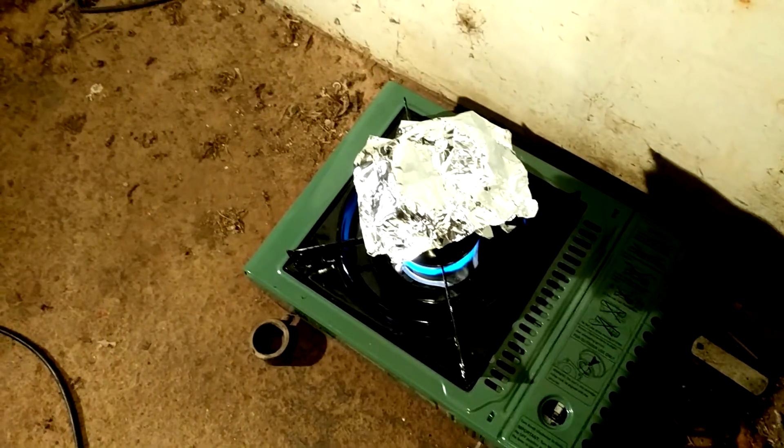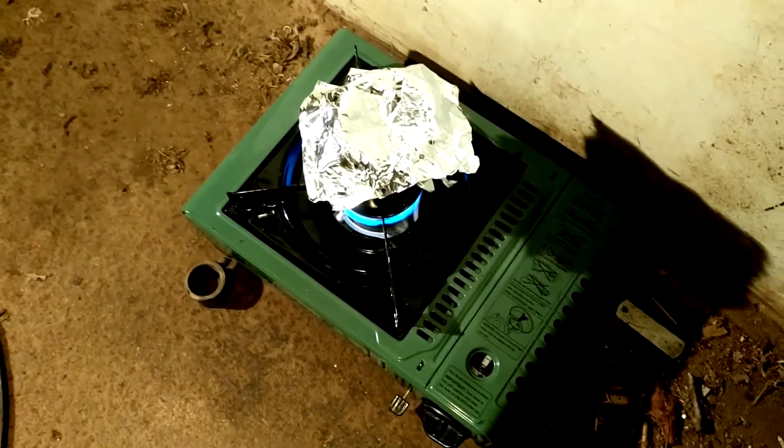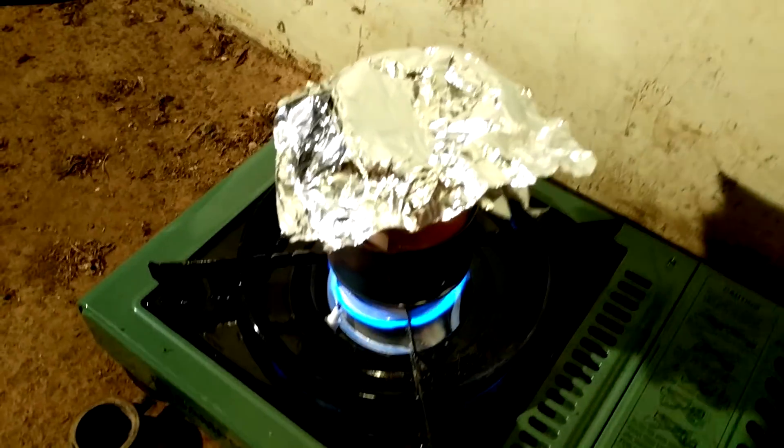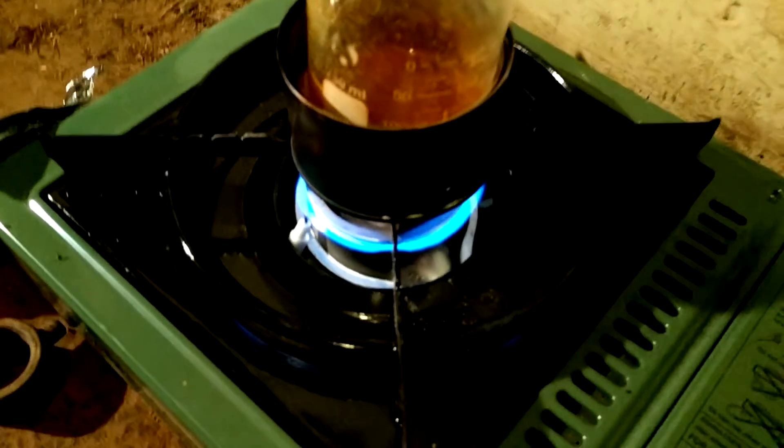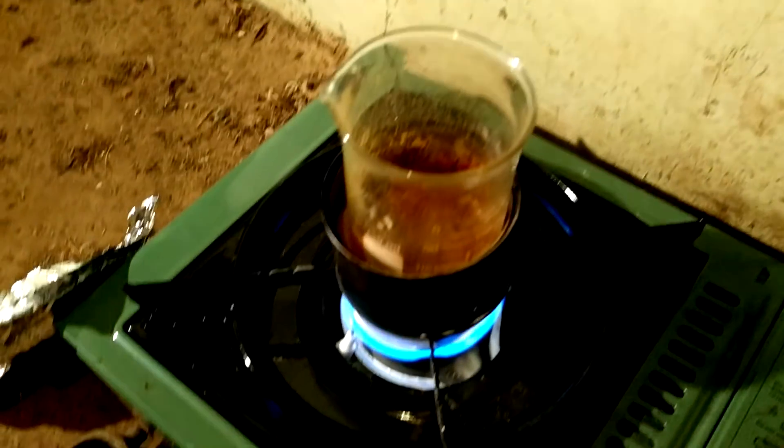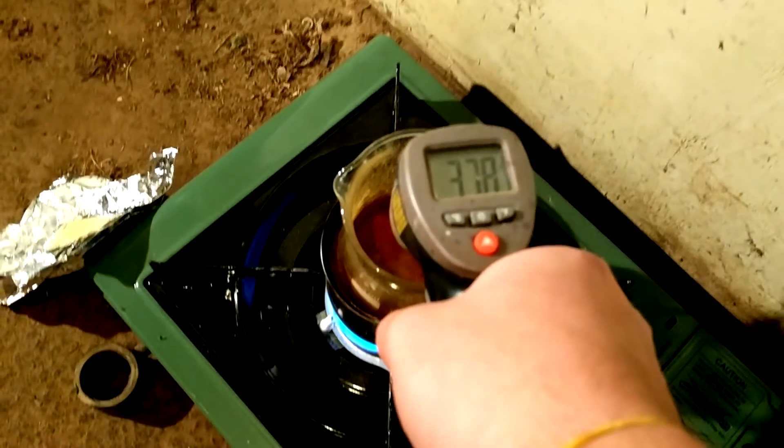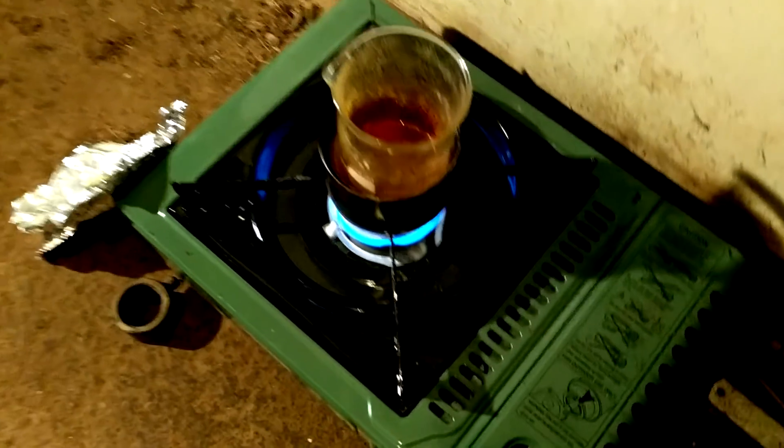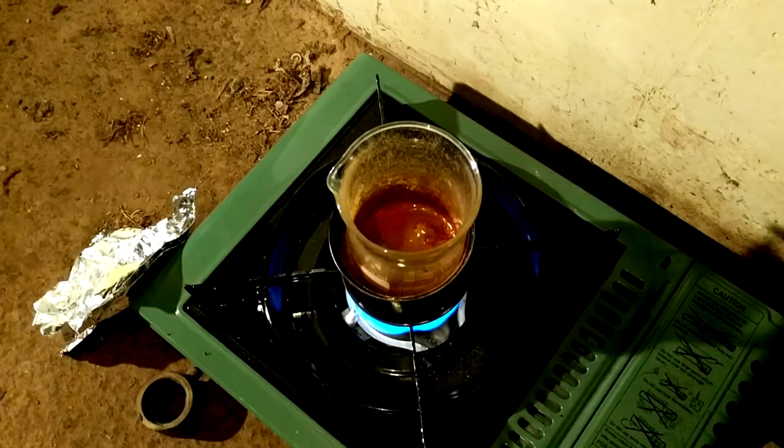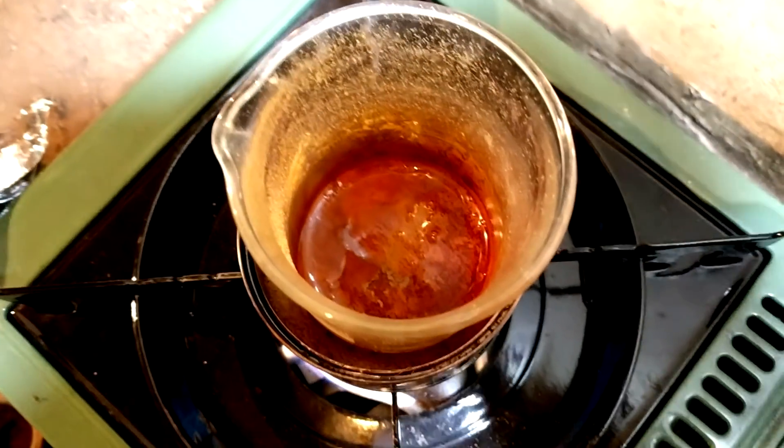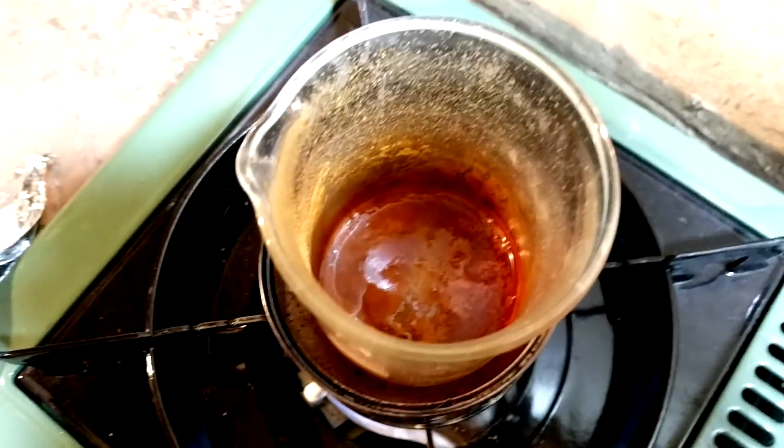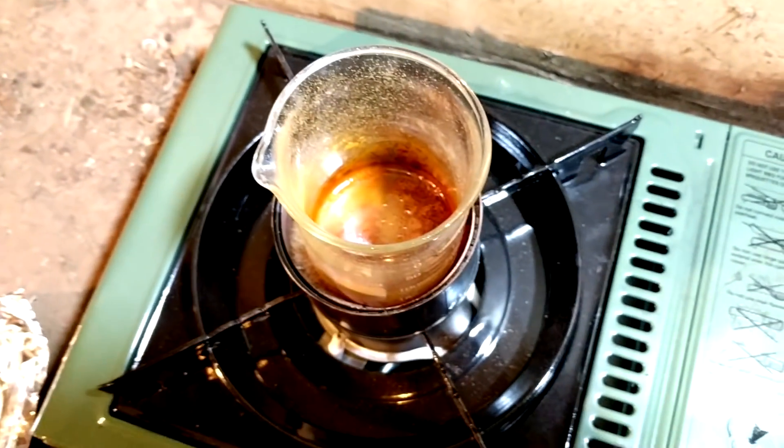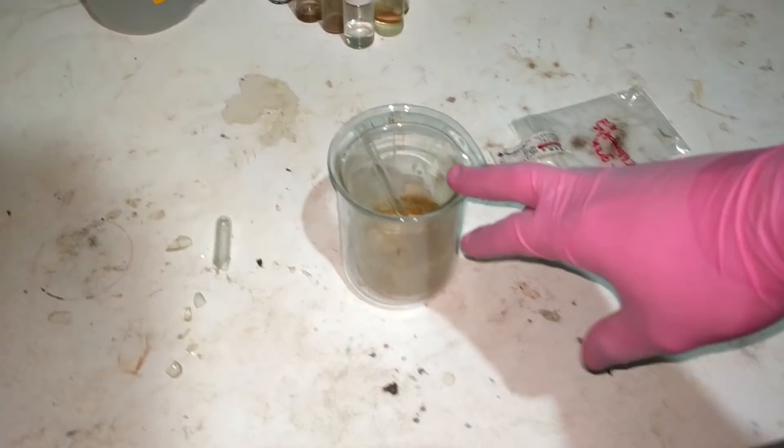All right it's been quite a while because I've struggled to really get the temperature up to an acceptable level. It really should be 500 to 550. The temperature is still only, yeah it's dropped to 380 but when the flame was on full blast we got up to about 460. We never managed to crack the 500 mark so hopefully this is enough. The bubbling has definitely tailed off which is a good sign. I'll come back when everything is cooled down.